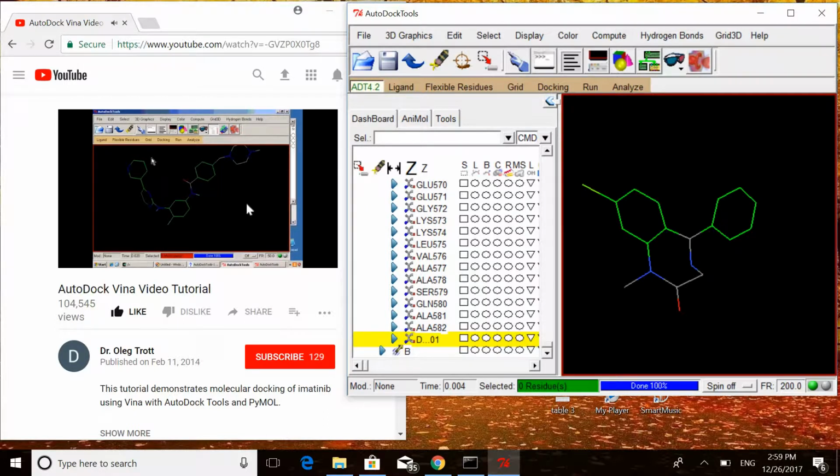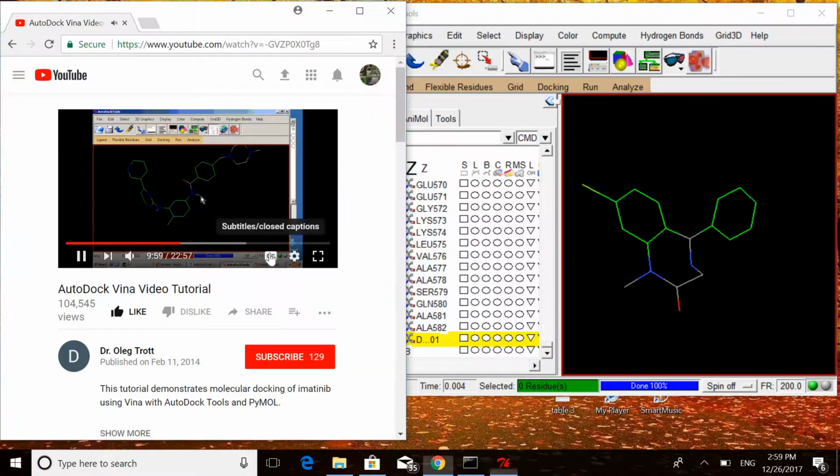I recommend using ligand structures that already have the correct hydrogens. This way, when you open them, AutoDock Tools will automatically merge the non-polar hydrogens and leave the polar hydrogens.